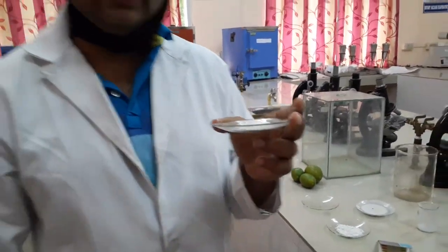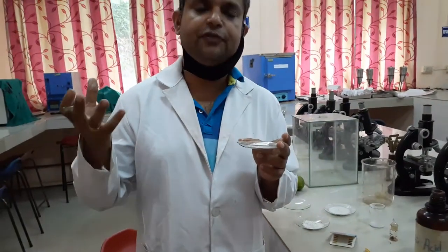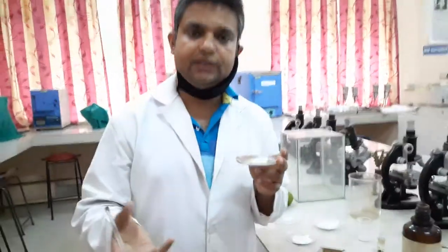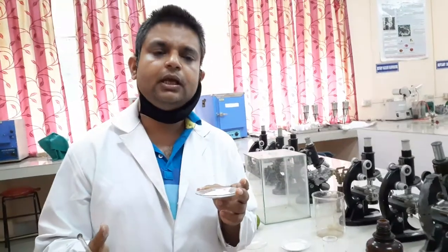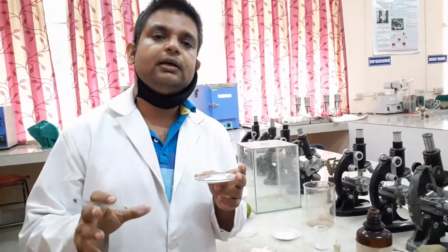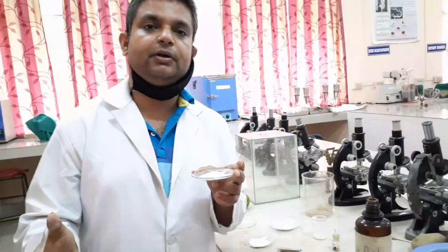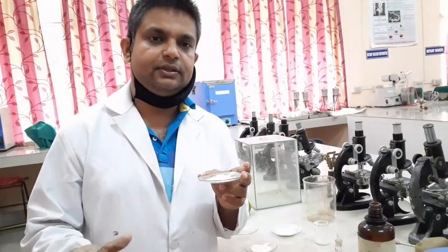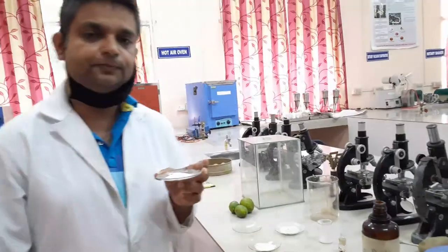You calculate the percentage yield — for example, from 50 grams of orange peel or any citrus fruit peel, how much you are getting. Then from that, you calculate how much you would get from 100 grams. This is the report of this experiment. Thank you.